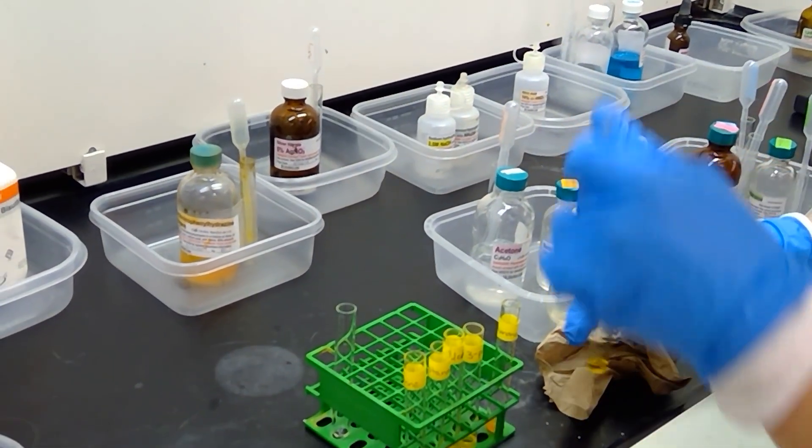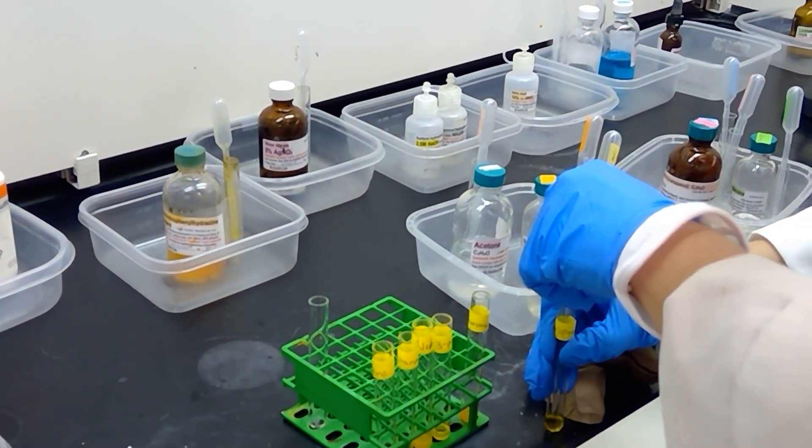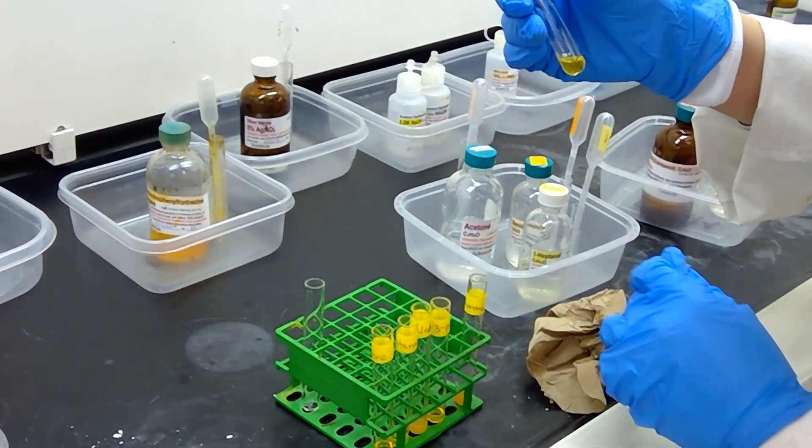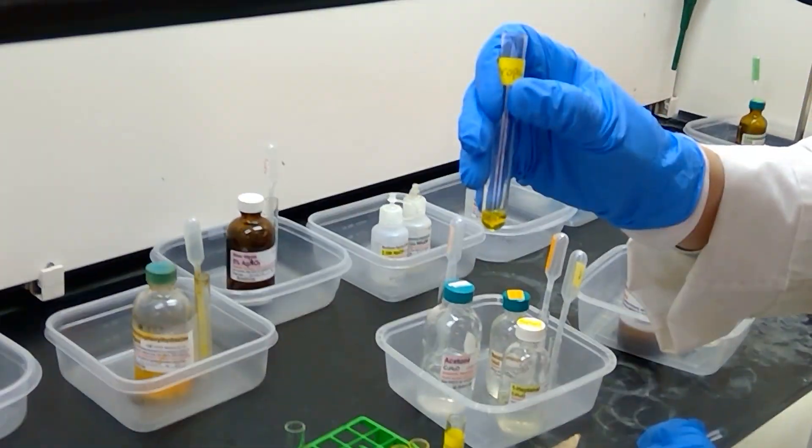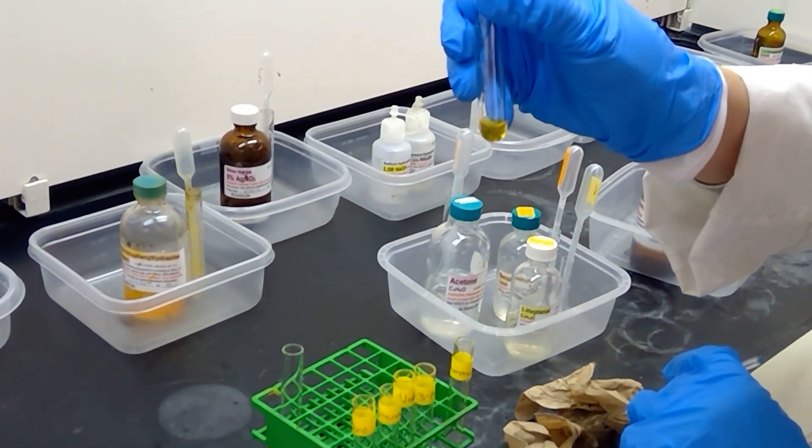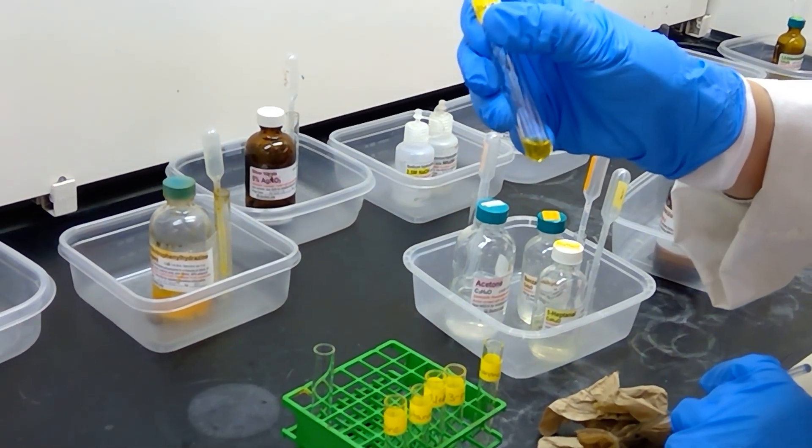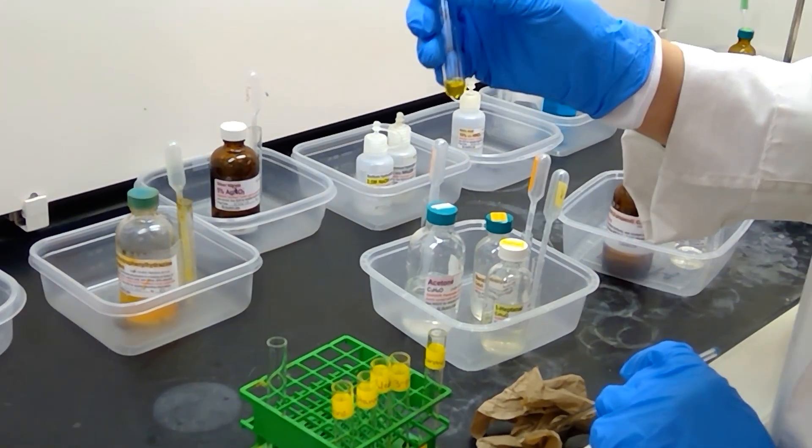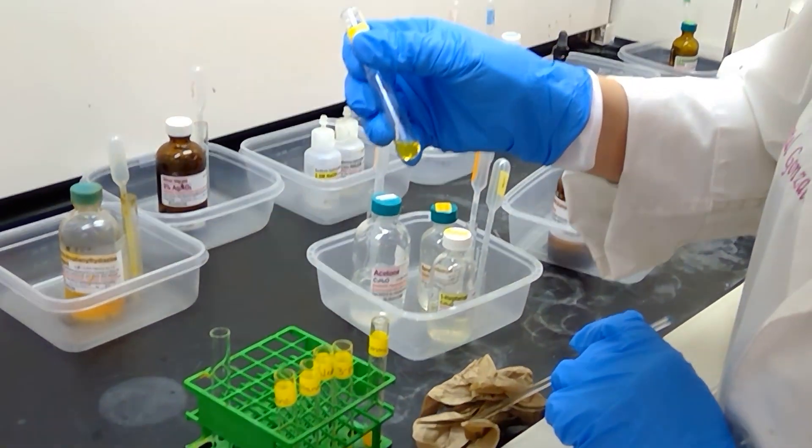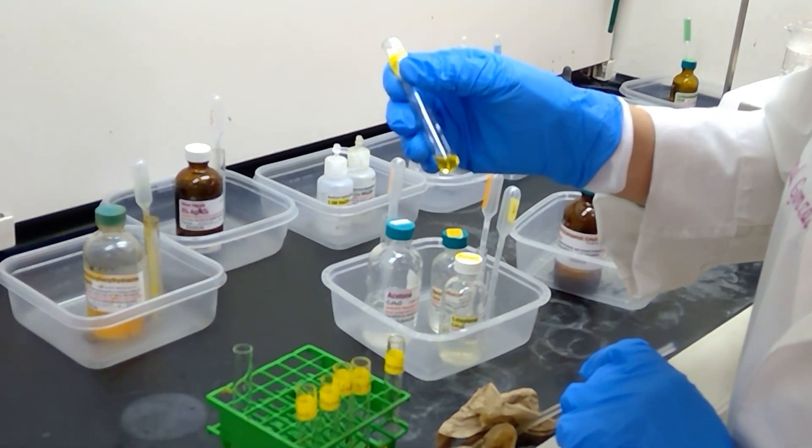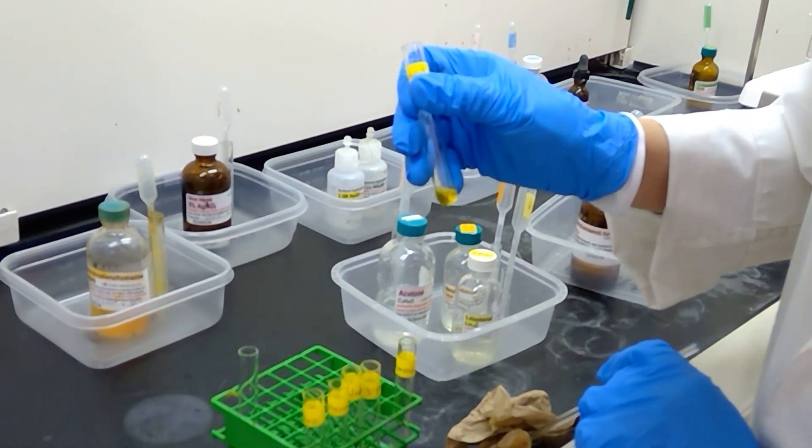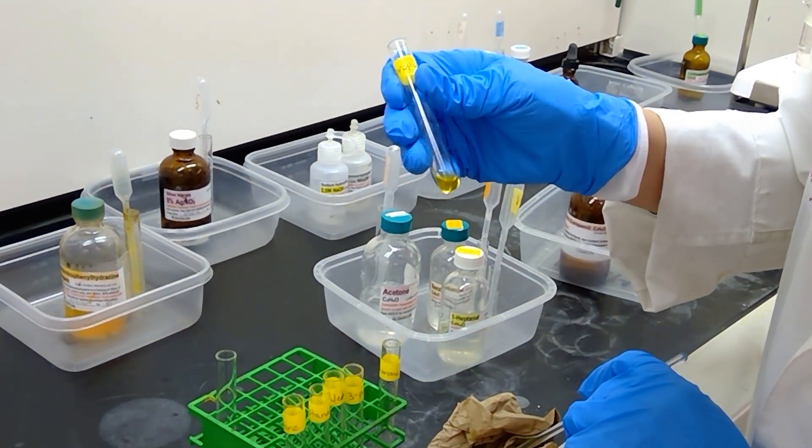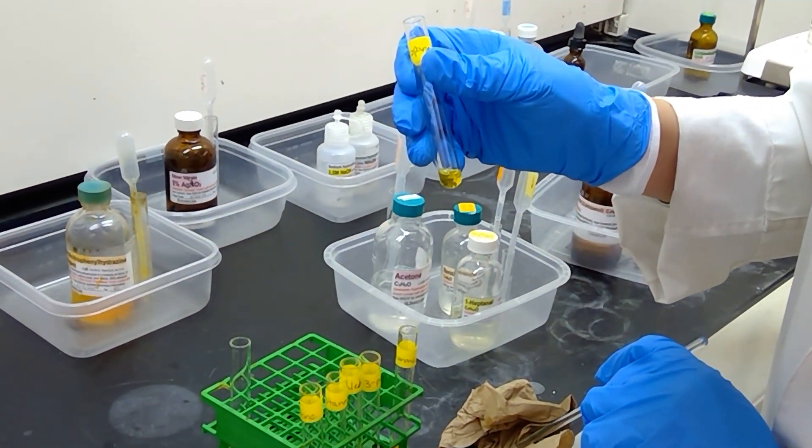2-propanol, let's take a look here and see what we get. The solution in 2-propanol is pretty much the same as what we saw with the 2,4-dinitrophenylhydrazine solution. I don't see much difference, and I don't really see any precipitate happening in here. This is normal. This is supposed to be a secondary alcohol, so we should not see a precipitate happening here.